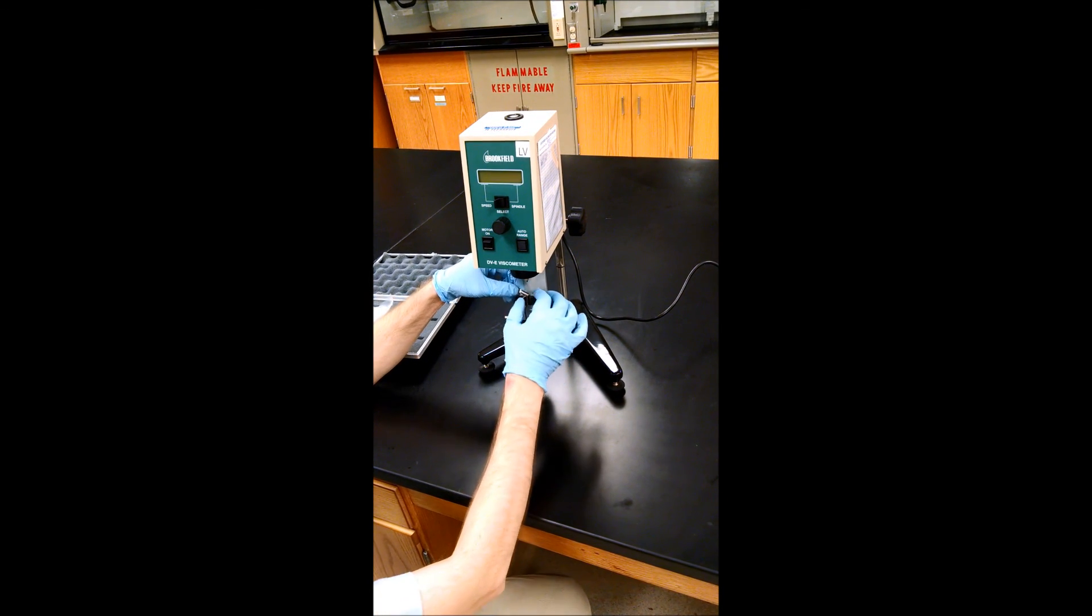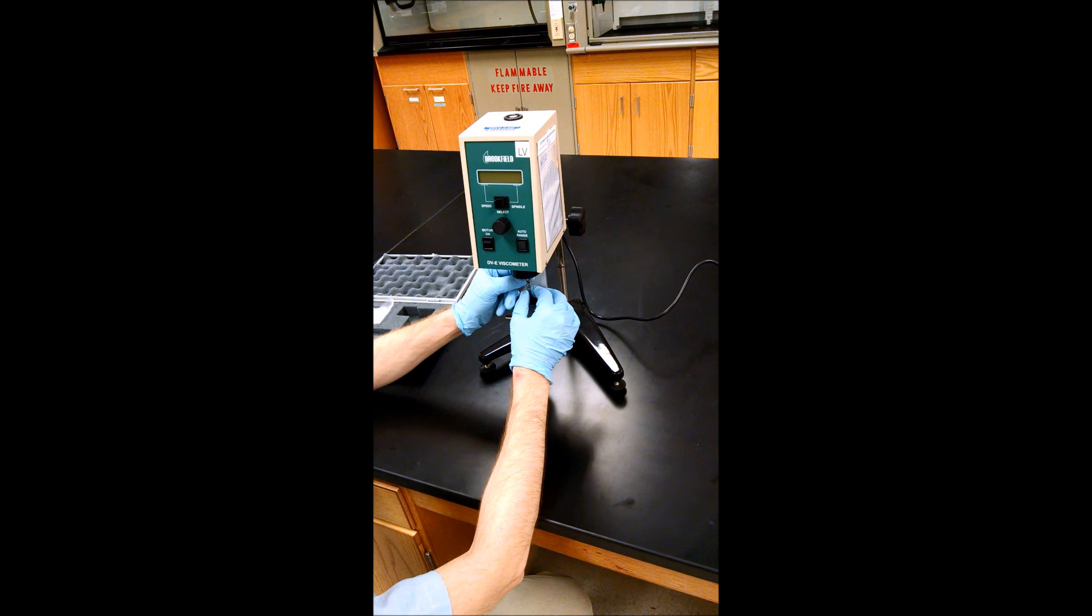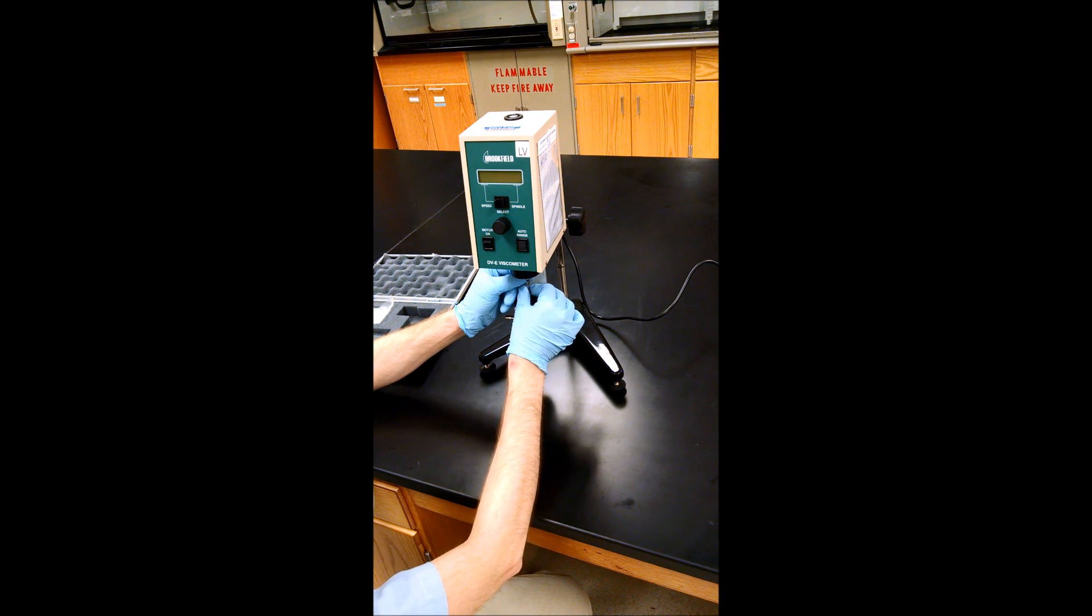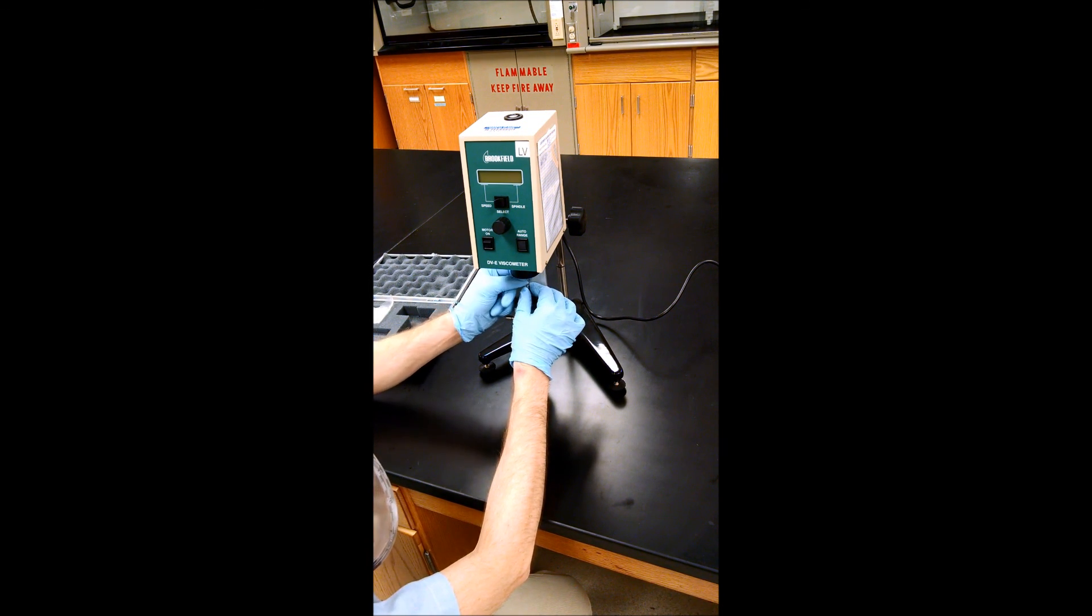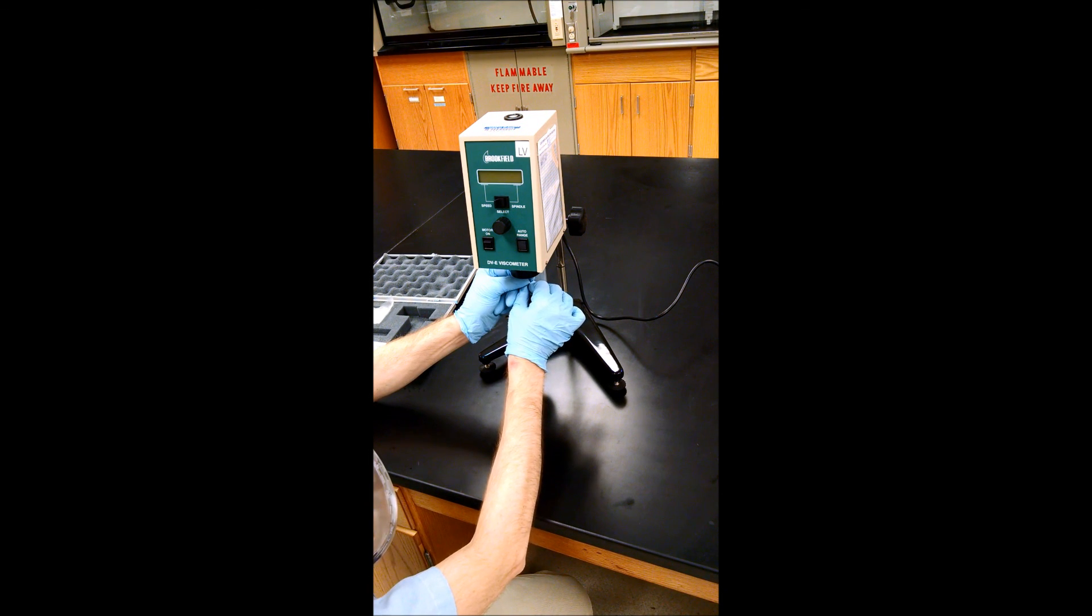Then you attach the spindle to the shaft. Lift the shaft gently and the spindle is reverse-threaded, so lefty-tighty in this case. So finger tighten it like that.